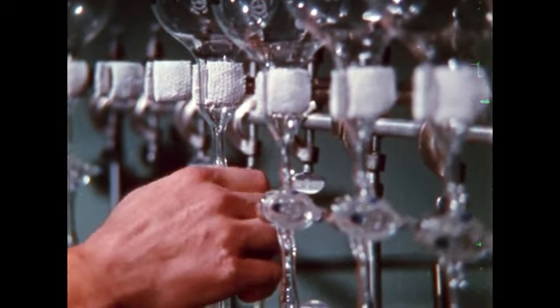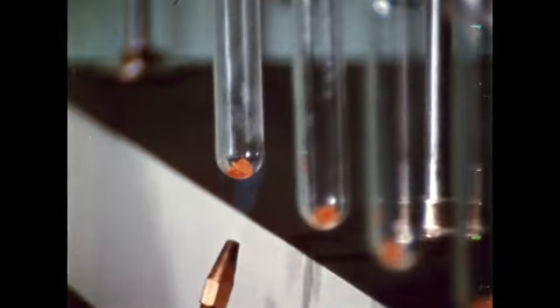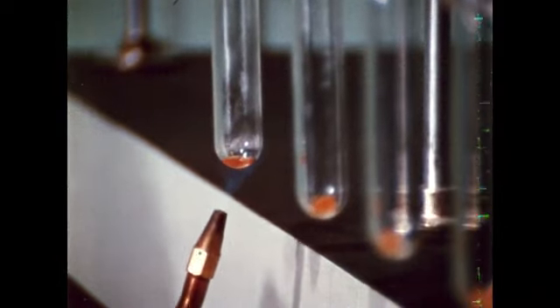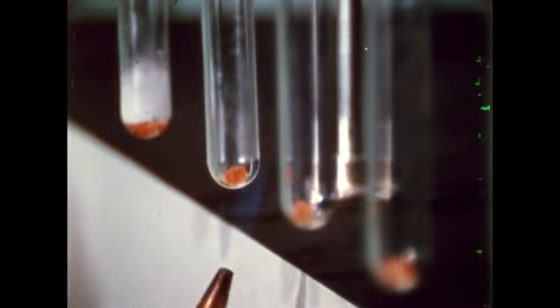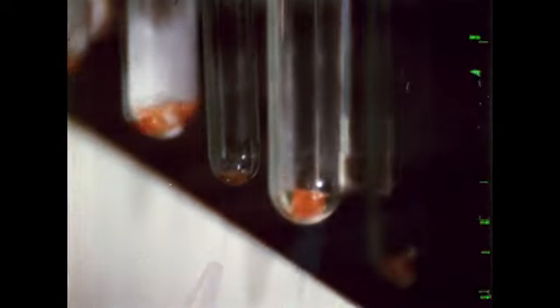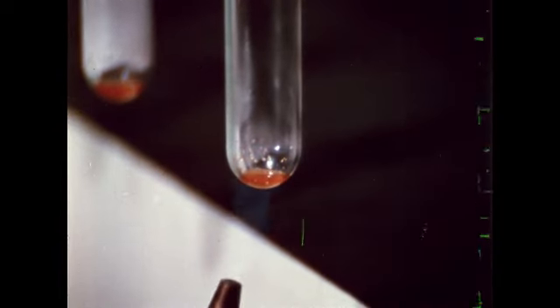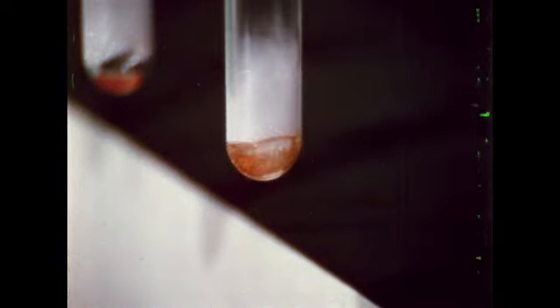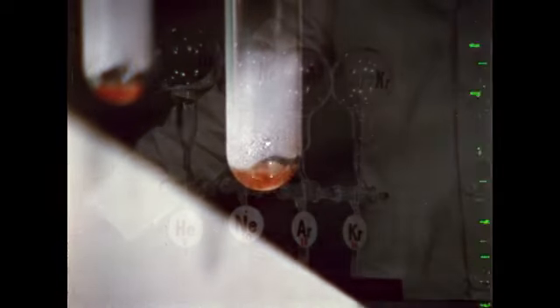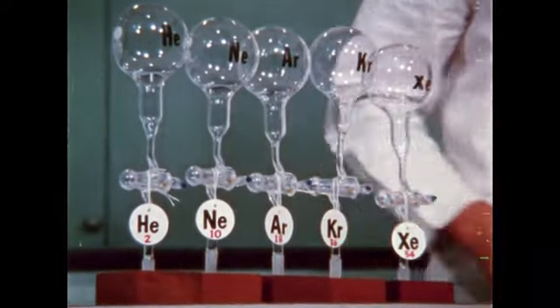We now let the inert gases into the 5 reaction tubes containing the phosphorus. The phosphorus is heated until it actually boils. What you see is not a chemical reaction, it is condensing phosphorus. Again, the 5 gases, argon, helium, krypton, neon, and xenon, are inert. Let's group them together as a family of elements.